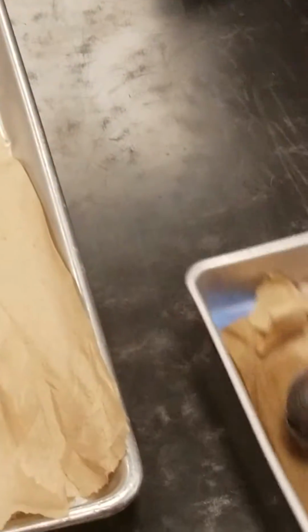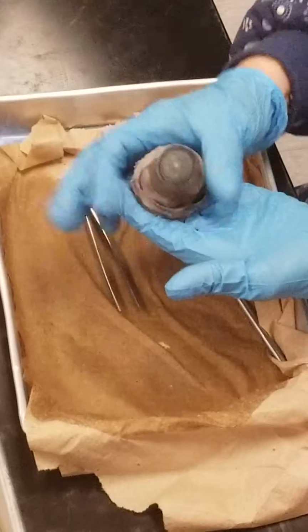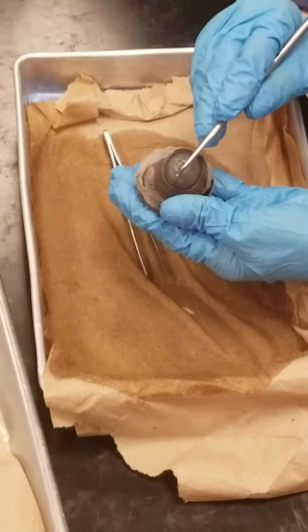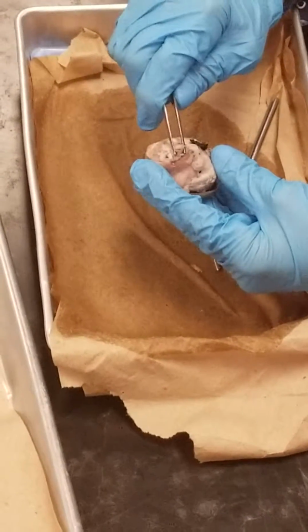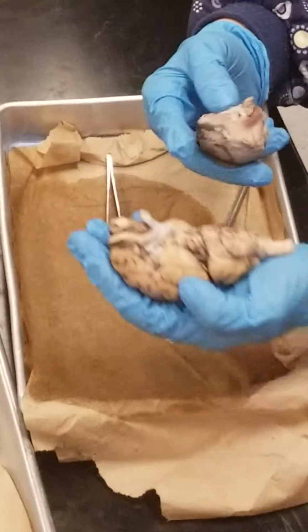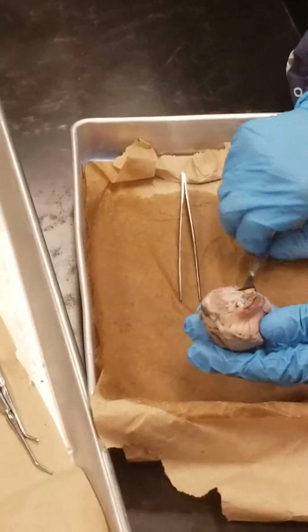Let's move to the cow eye here. This is what we see when we look at a cow. That's the cornea there. That would be the anterior structure we need to know, the cornea. When I turn it over, what we see is the optic nerve. So what I'm pinching here is the optic nerve. So that would be, as I showed you before, it would come off the brain here and here, and then go into the back of the eye to innervate vision. So there's the optic nerve.